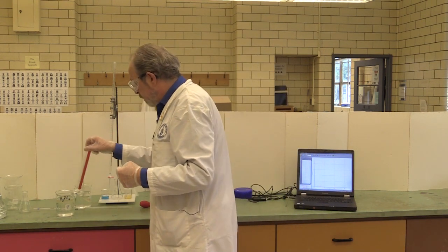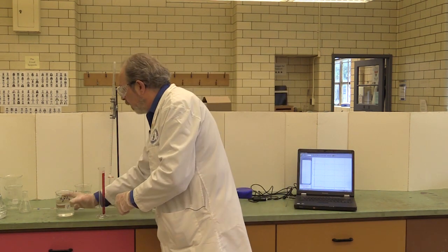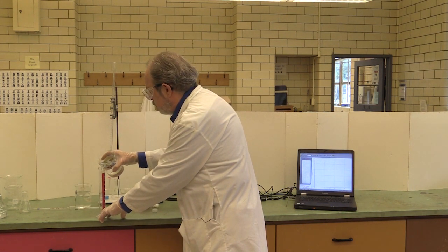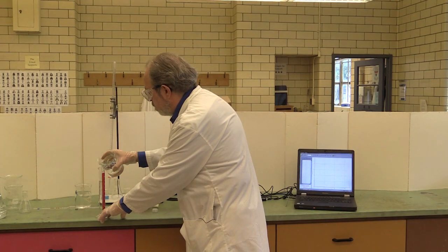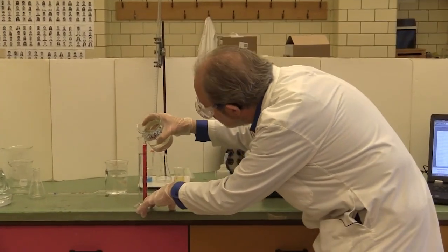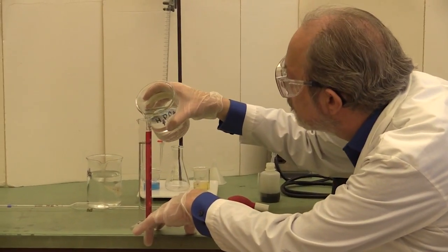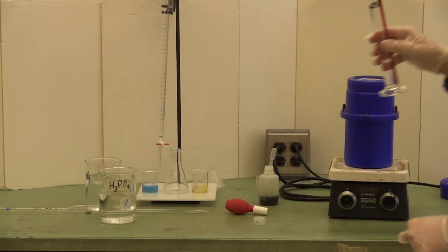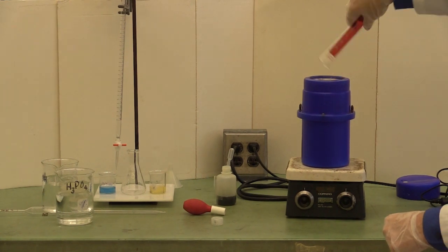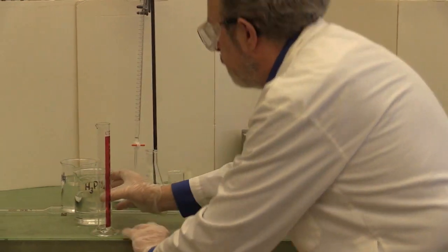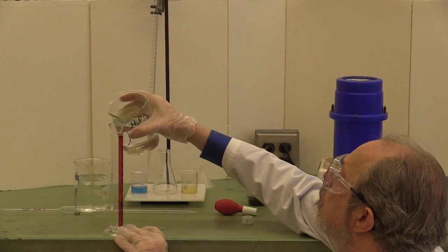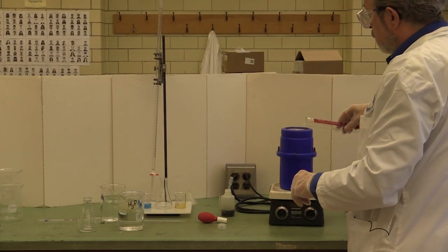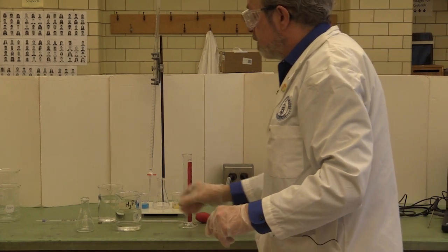Use a grad cylinder, but be reasonably careful about how you do that. There's 100. Just pour this directly into the calorimeter. And now I need 25. All right, so I've now got 125 mils of phosphoric acid sitting in the calorimeter.